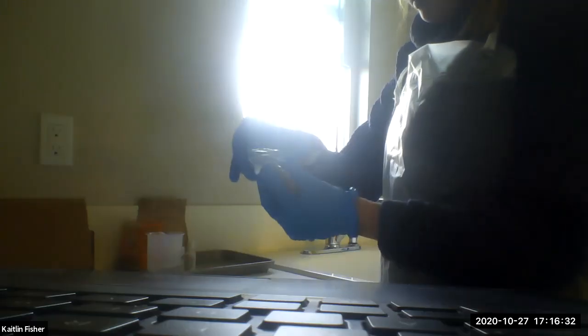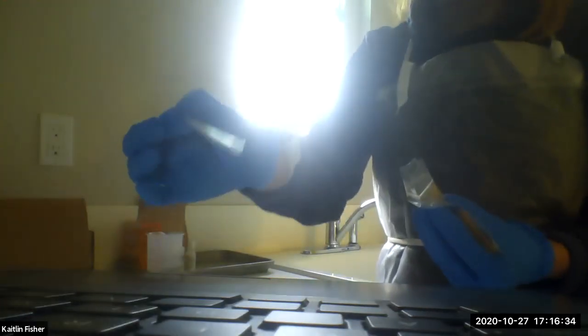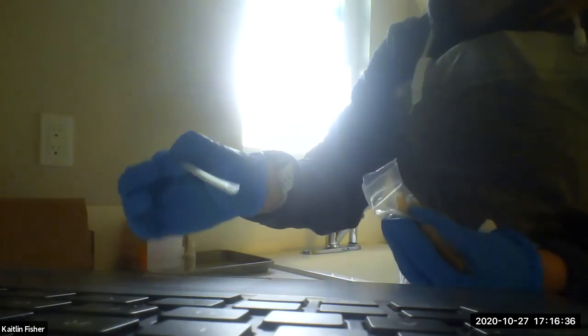And then the last thing we have in this bag is this little scooper right here. We're going to need that to transfer some of our willow bark and our chemicals a little later. So I'll go ahead and put that spoon outside of my tray on my equipment table.